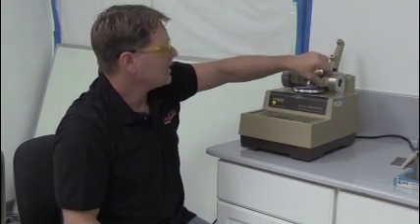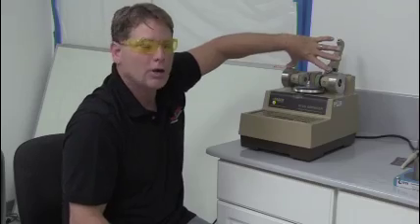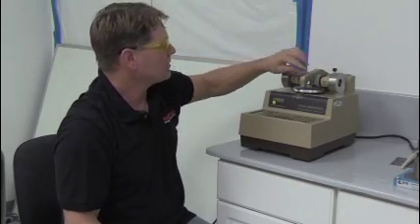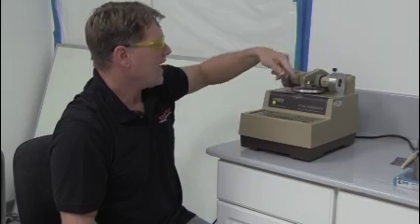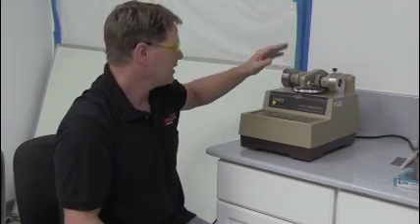We drop these down and on each side we have a thousand gram load. And then this is a little vacuum attachment. The purpose here is to suck the dust away as this revolves to keep the test true.